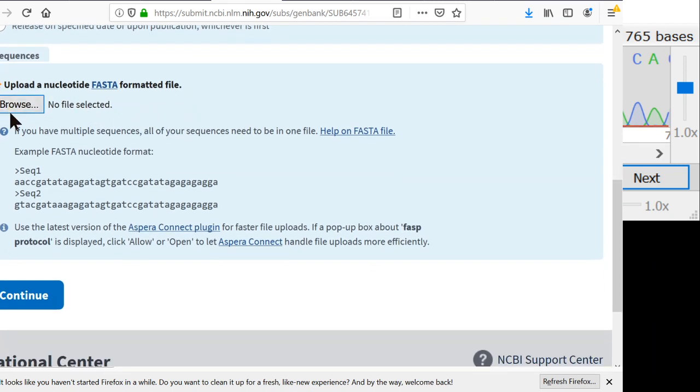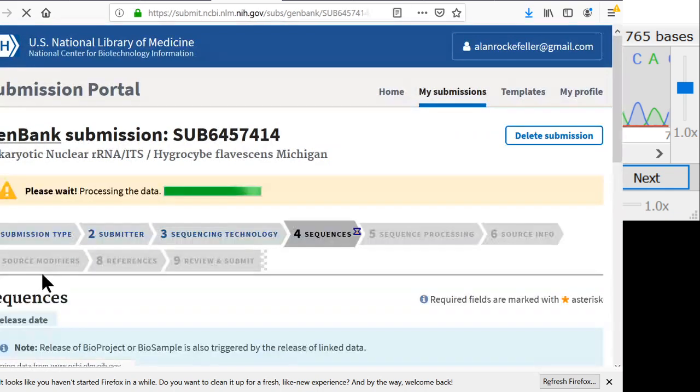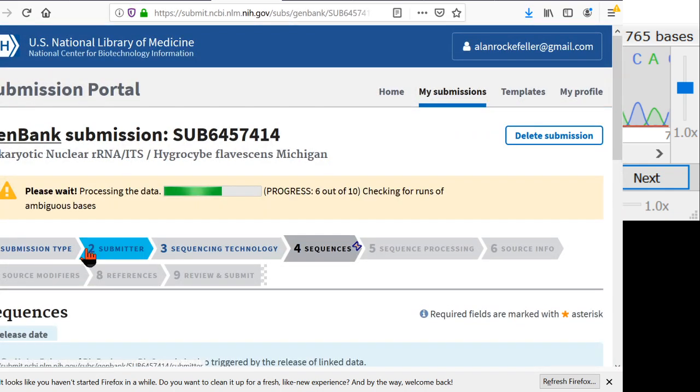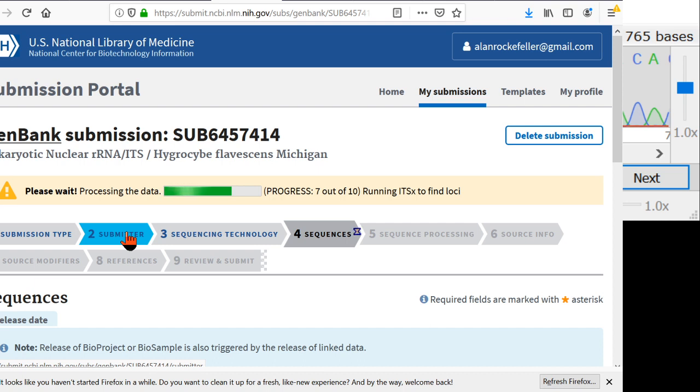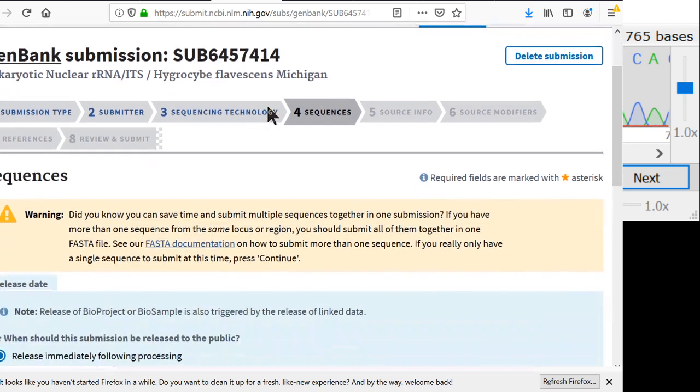Here's where I give them the FASTA file that I just generated. So I think I called it flavescens.fas. Here it is here. And we'll continue. And now what it's going to do is run a program called ITSX in the back end. ITSX processes the ITS sequence, and it looks for certain motifs that it knows should be in there. So it knows for sure that you actually submitted an ITS sequence. And if you give it some other sequence from some other gene, it'll give you an error here, and it'll say, no, I know this isn't an ITS sequence because those conserved regions aren't there.